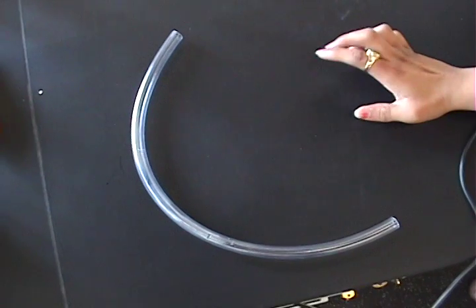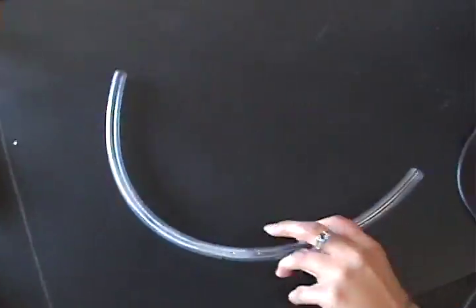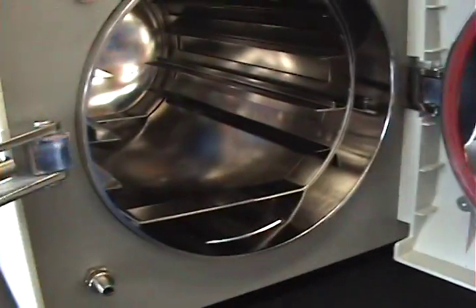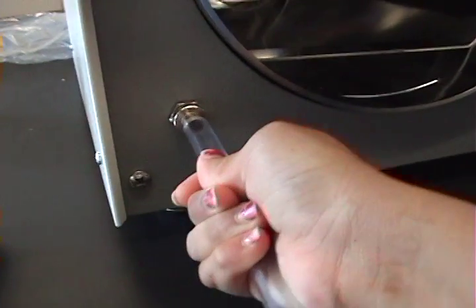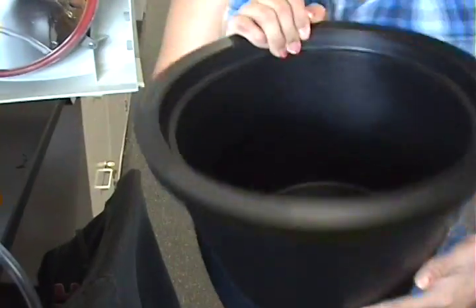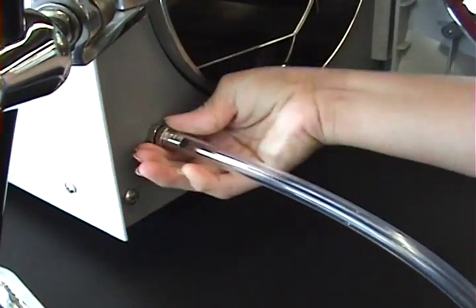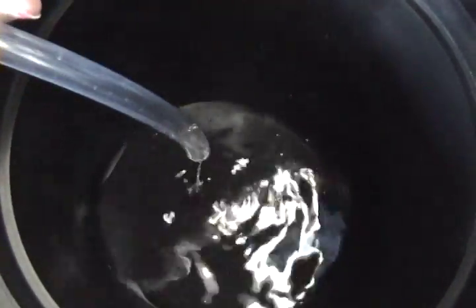This is the tube you will use to empty out the reservoir from any old water. Once everything has cooled down, plug the tube into the hole and loosen the nut above it. Take an empty bucket — any will do — and place the tube inside. This is where the water will dispense.